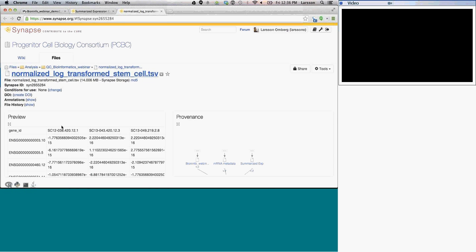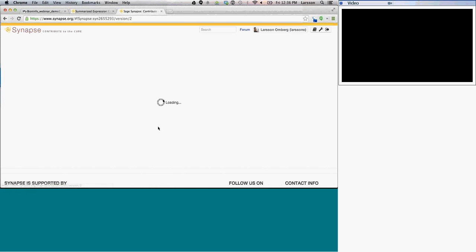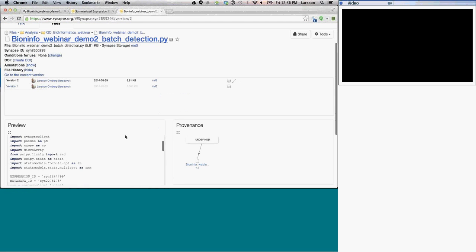So back in Synapse now, this is now the data set that I had generated using this code. So this is something you can share with one of your collaborators. We have information about how it was generated, so I stored the code. So if I click on here, I can actually see the code that was used to generate this.